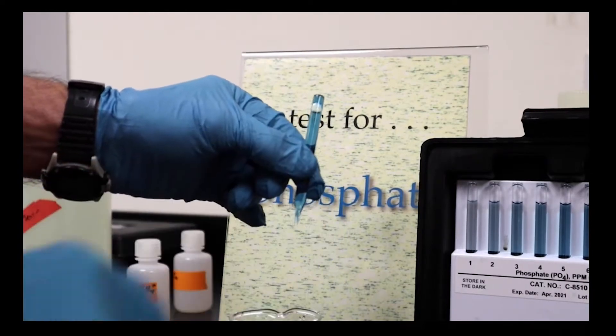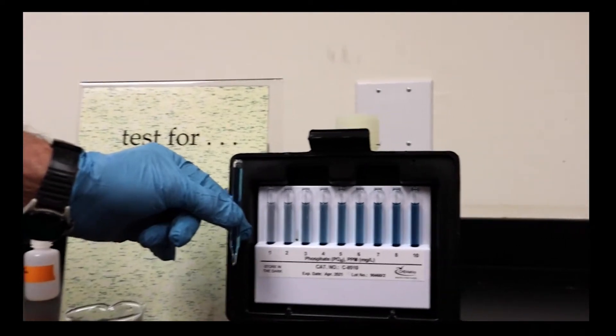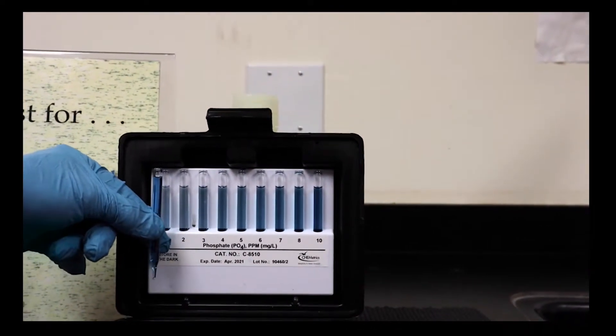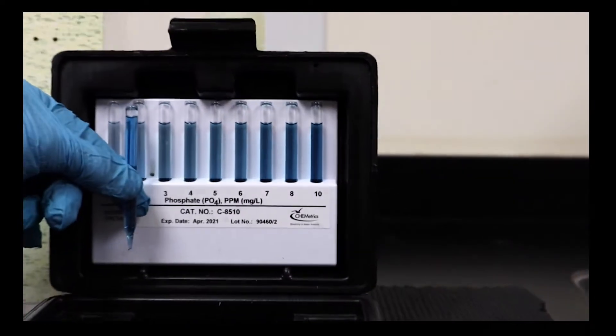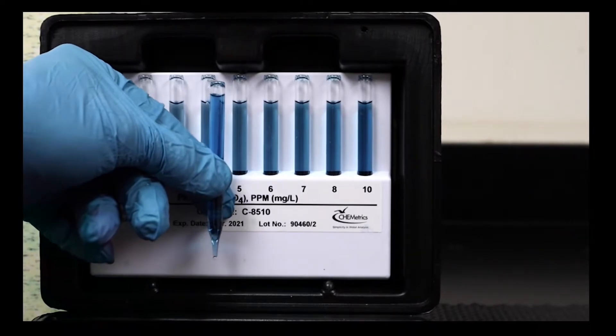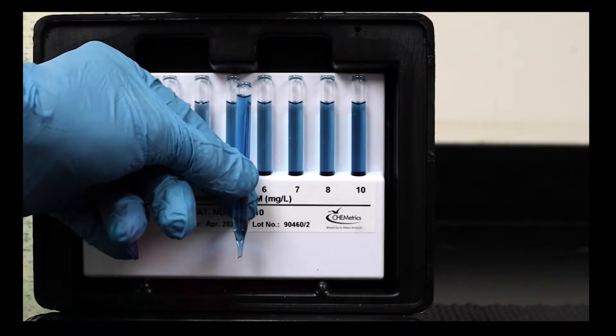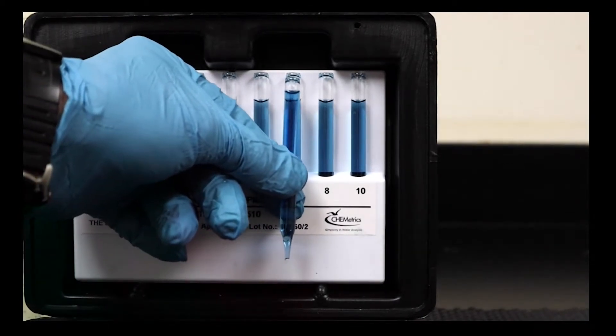We're not quite there as far as color goes, but let's take a look. So far, so good. We see that it's darker than one, darker than two. What do you think?